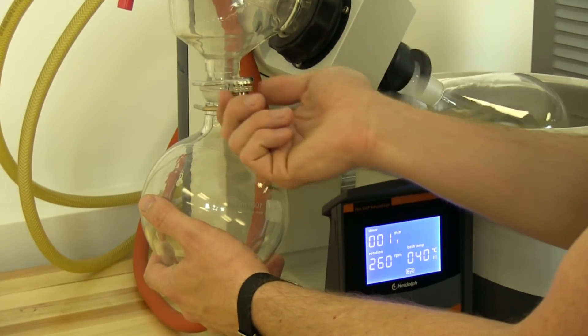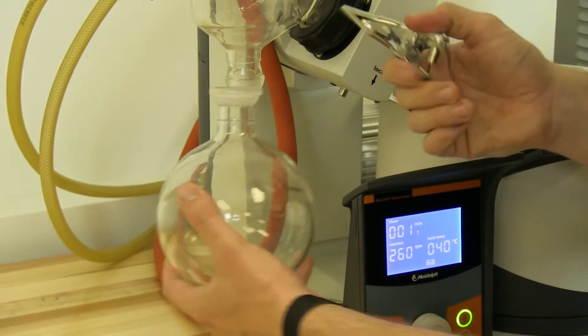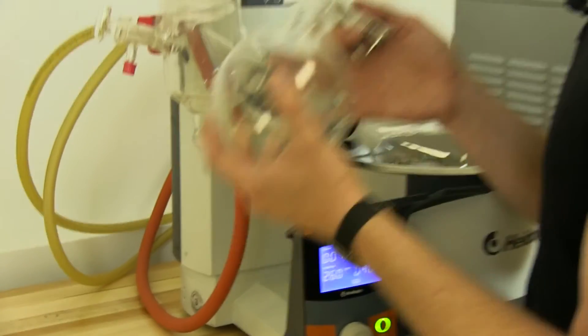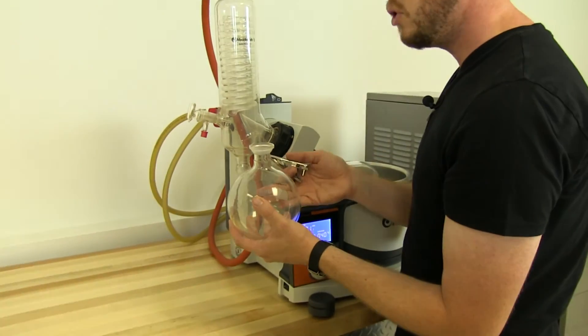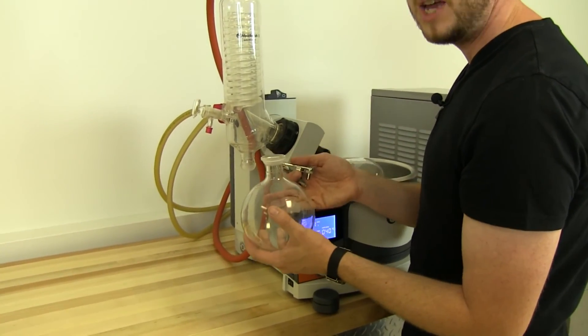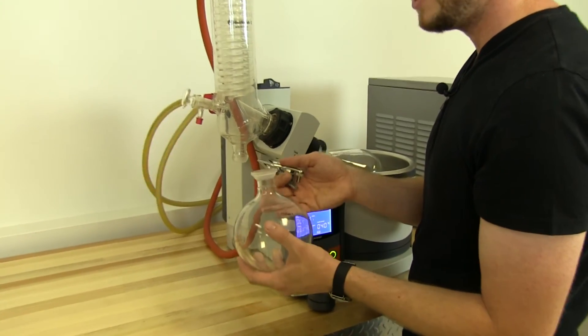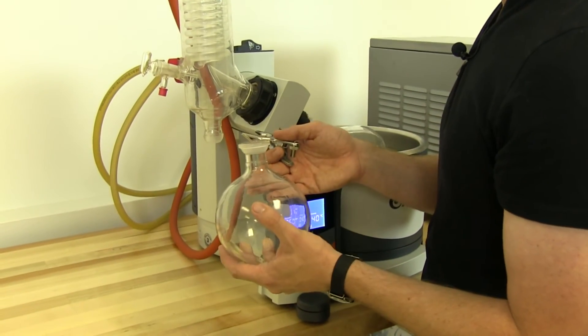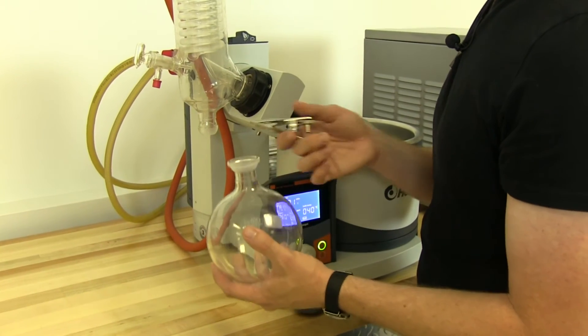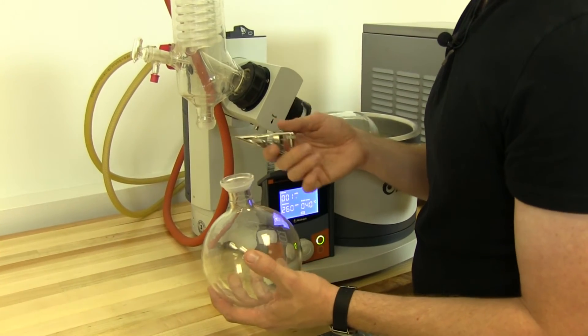Since distillation is such a lengthy process, it's good to break vacuum every once in a while. Smell, get the aroma, take a small taste, pour it into a vial or a pipette. This is such a lengthy process, you don't want to spend hours and not have the right result.